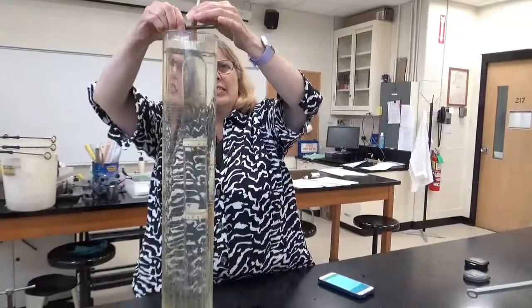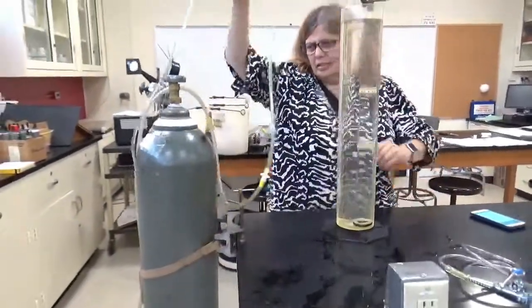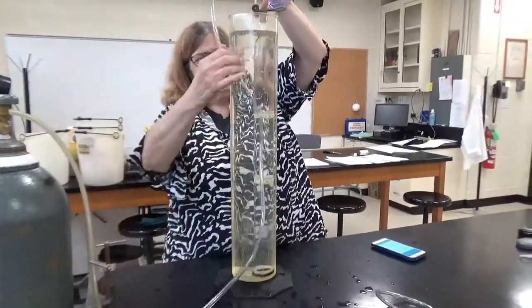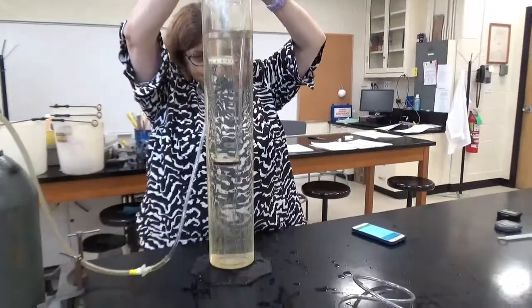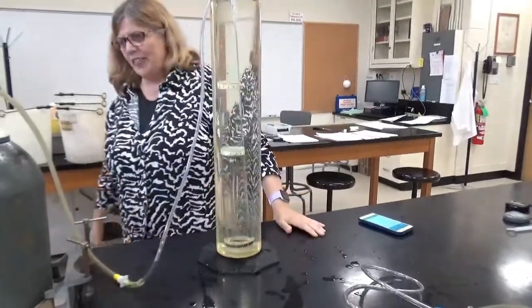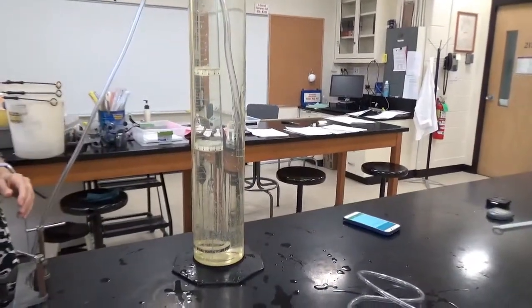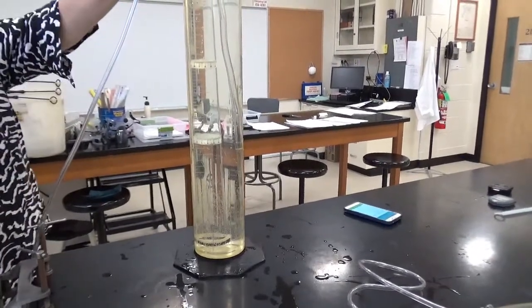So now we're going to do carbon dioxide, and carbon dioxide's in this awesome tank, with a regulator that doesn't work too well, so sometimes we get very big amounts of CO2 coming out of here. So we got a little hook and we got a tube, and let's see if we can control it well. I probably should have done this first, but it's all right. Just got to be really careful.